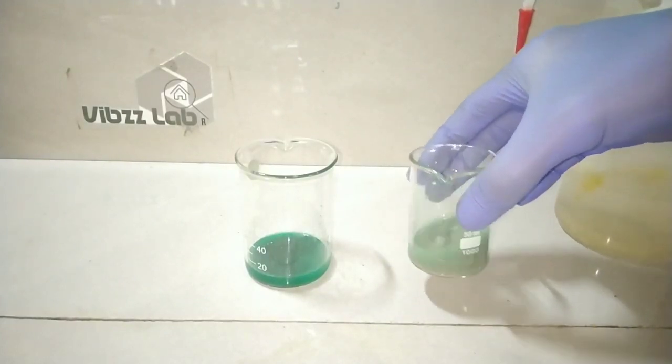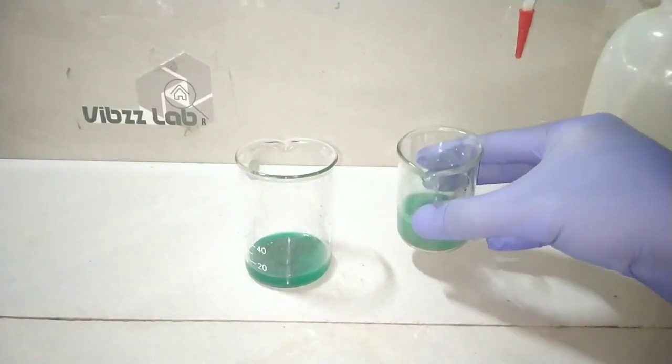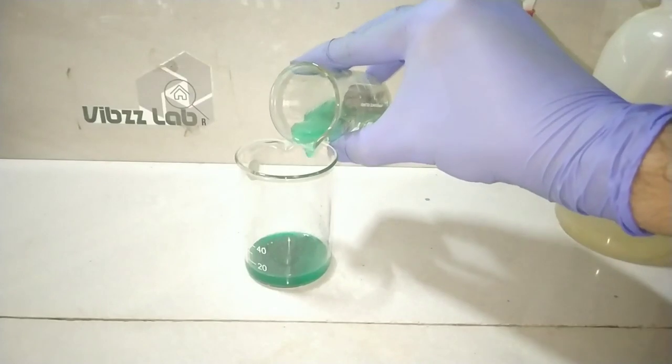Here I have just washed one time with water. The greenish blue solution to my left might be containing some amount of silver salt. So to bring that out, I will add some copper metal into it.